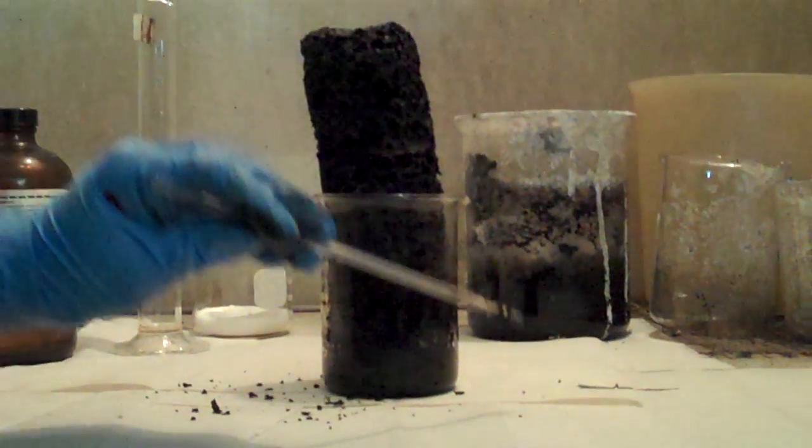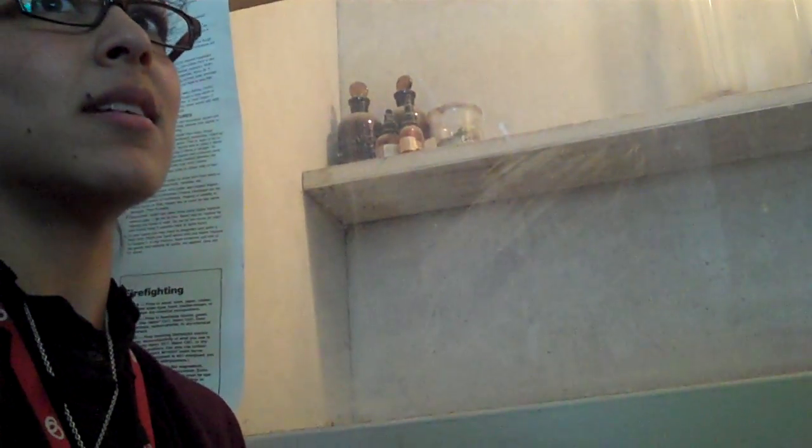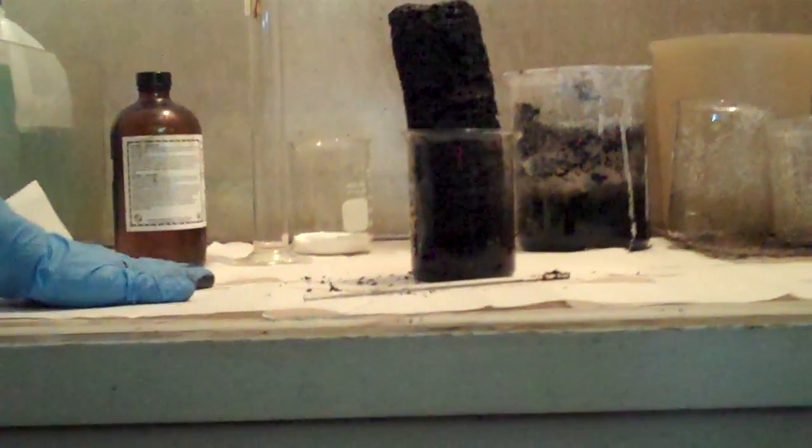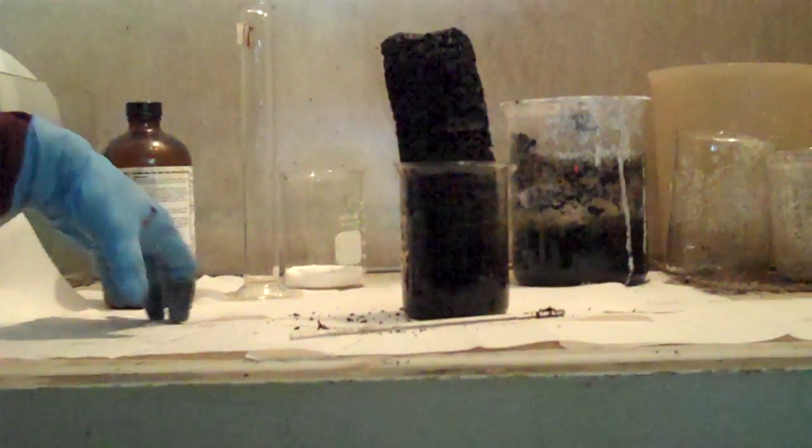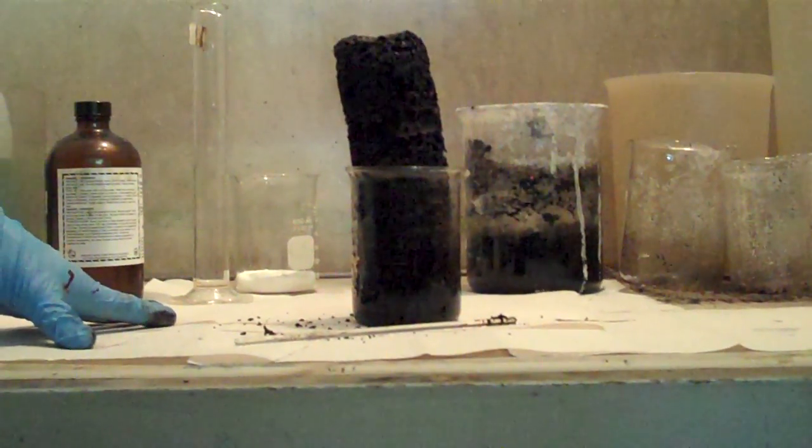Wait, so you said sulfuric acid is still present. Then what about if it gets everywhere? Where is it getting? Oh, I've covered the bottoms here. And to neutralize an acid, I put a base on it. And that's what the, and baking soda is a base. So when I neutralize the reaction, you guys can watch that also after you're done your exit slip. It's going to bubble and fizz, and the reaction is going to happen there as well.